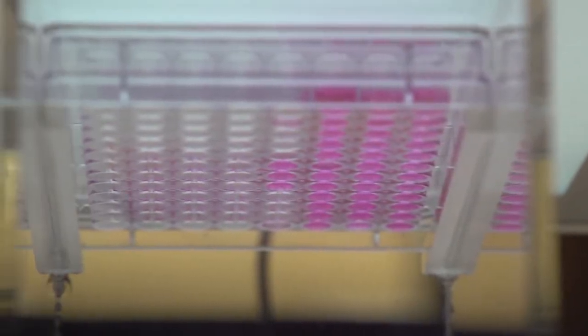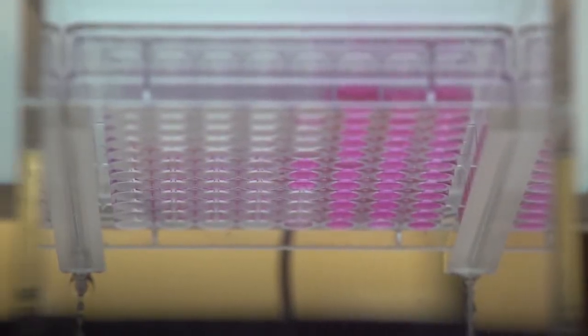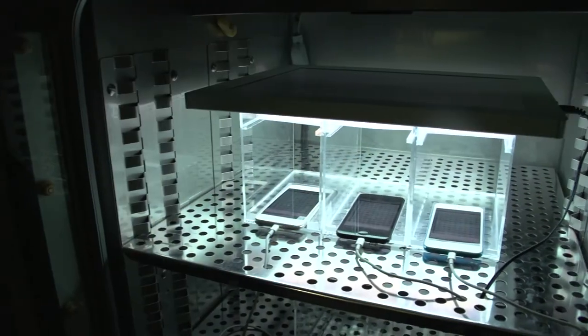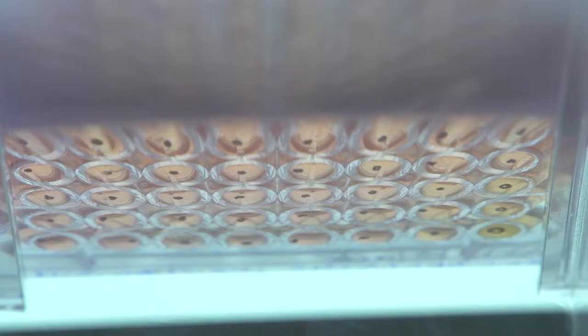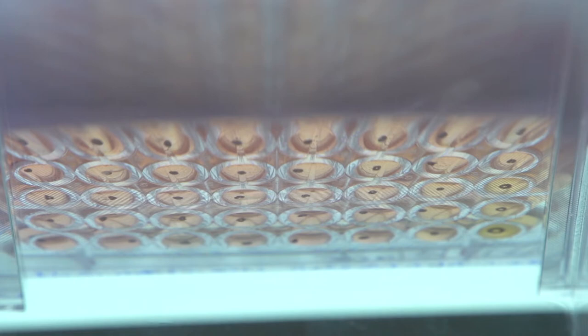The system is a typical 96-well plate with our cells growing in there and we want to watch them move. Moving has to do with migration, toxicity, cell-cell interactions and all that. A way to watch a bunch of cells move, we could watch it microscopically with the iPod underneath the system. And the app that was designed by Will takes pictures at intervals that you decide.